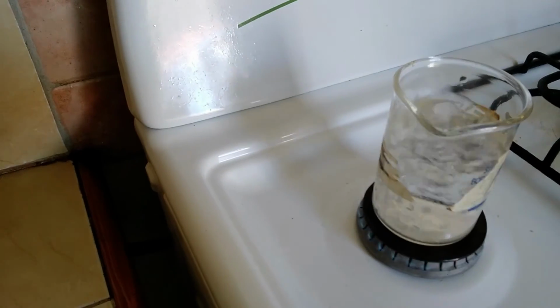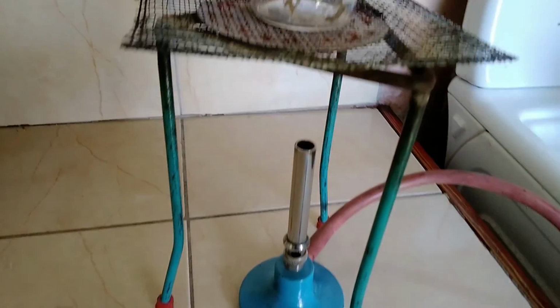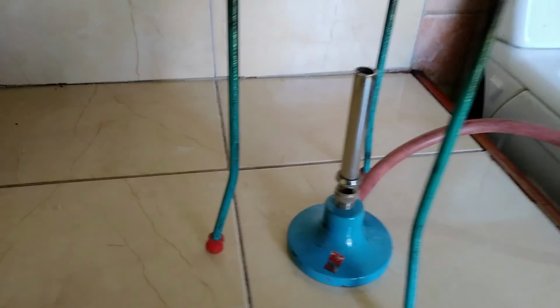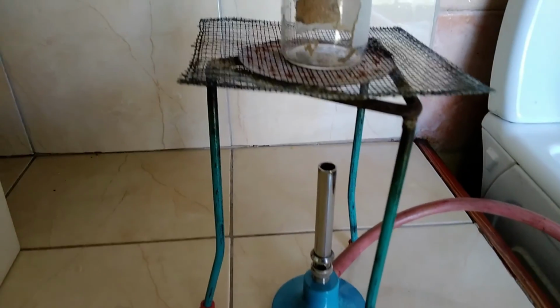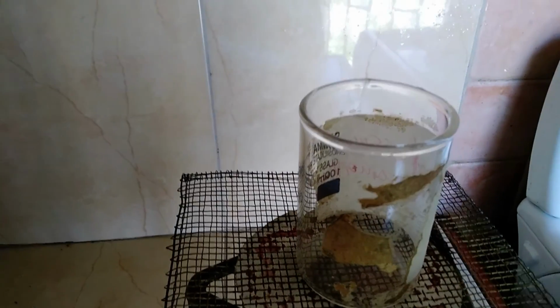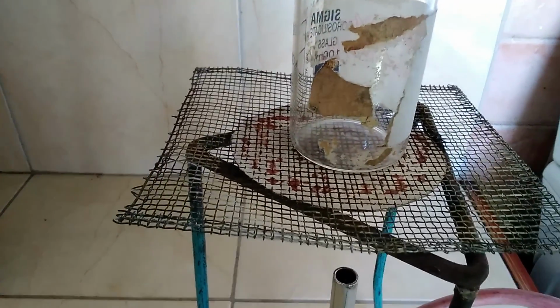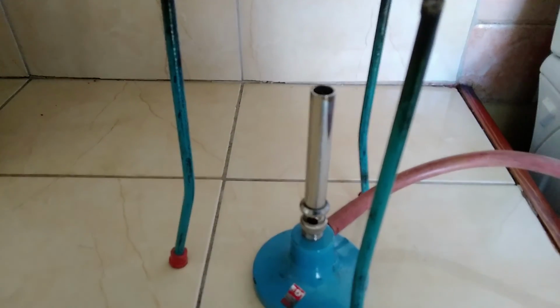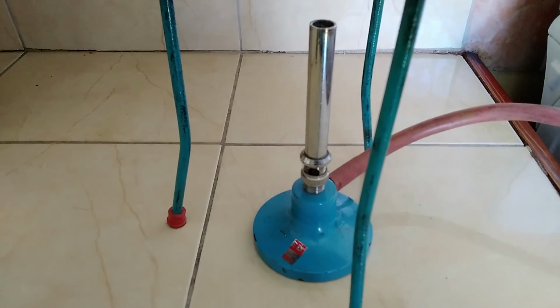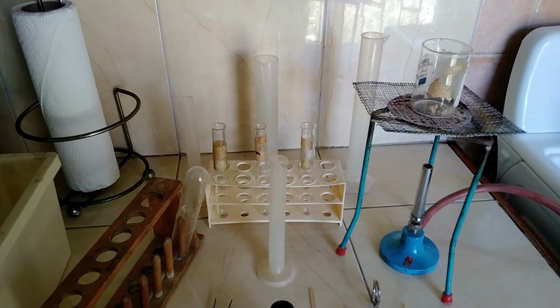So if we were at school, this setup that is on the stove would have actually been this. It would have been the Bunsen burner under here, with the tripod, that 3-legged stand, wire gauze, and the beaker on top with water. But due to COVID, we are unable to do that, so we have done everything we can for our students. We took these things home, and we are still carrying out the labs so the kids can see it online and be able to have an appreciation. Okay, so this is the setup at home.